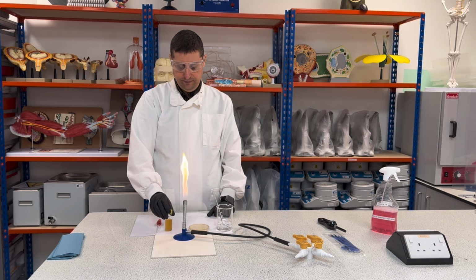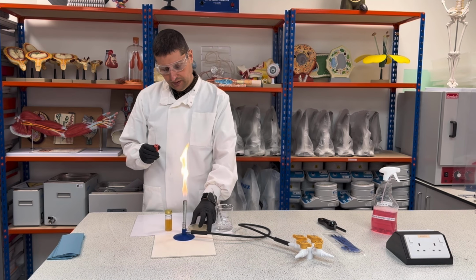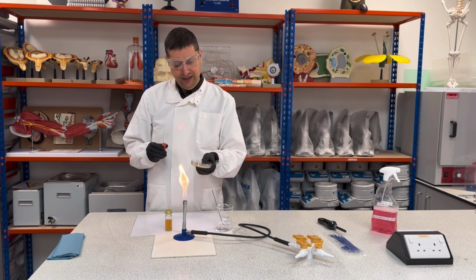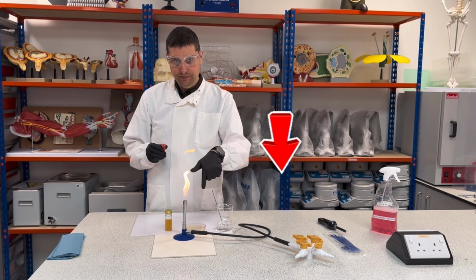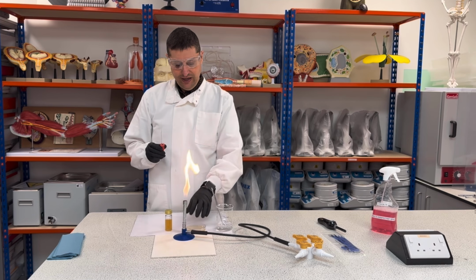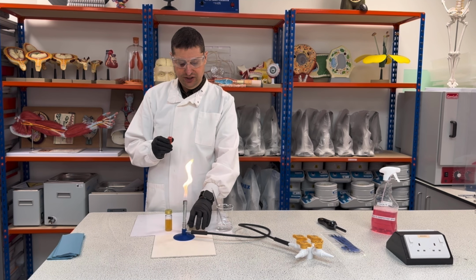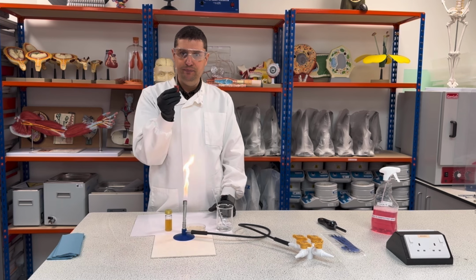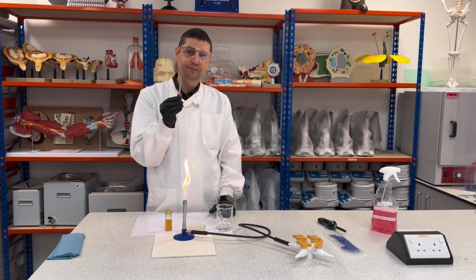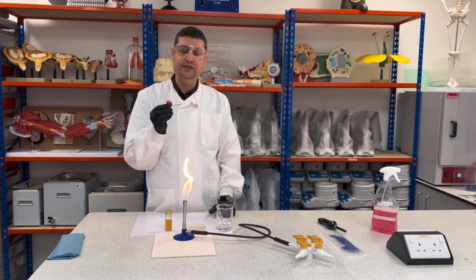and my broth. So the first thing I need to do is put my dish with the agar facing down, okay, at the bottom, and the lid facing up, right? So I can just open up and close this up. The tip of my pipette is contaminated, so I need to disinfect it. How will I disinfect it?